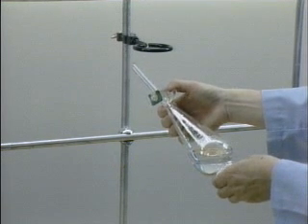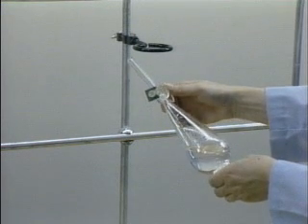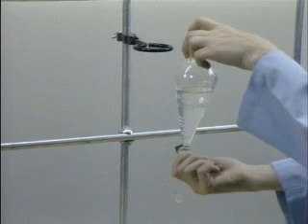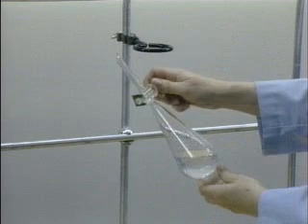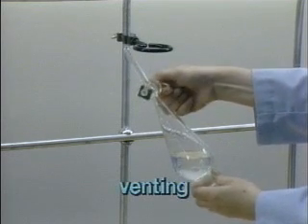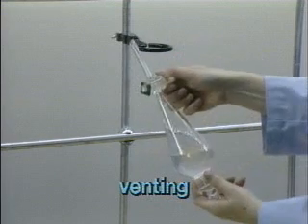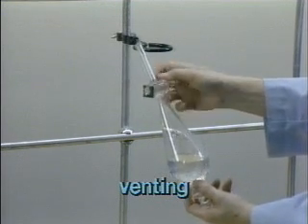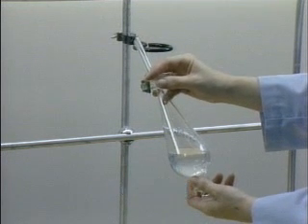The stopcock is held in and open to release the pressure of the solvent vapors. The stopcock is then closed and the funnel is turned upright. This procedure of turning the funnel over, opening the stopcock, and turning the funnel down is called venting. The funnel should be vented several times. If it is not vented, the pressure of the solvents may build up and pop off the stopcock or stopper.